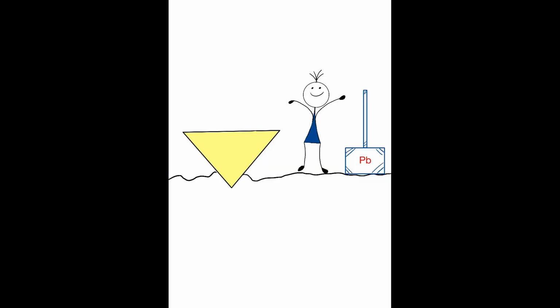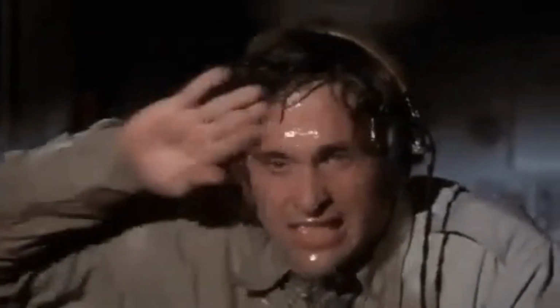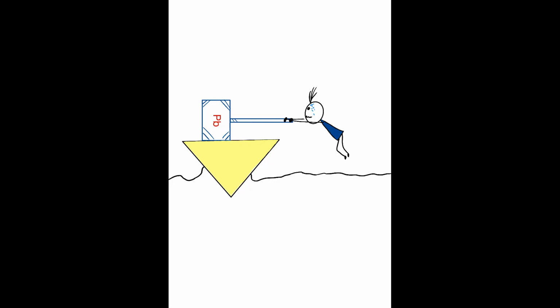Looks like Bob is trying a load step experiment next, another method to achieve high strain rates. With the tip already in contact, just a little bump needs to be brought up. Just let me get this hammer up here. It's so heavy. Just don't tip over, Bob. Smash! Oh my God, I'm so sorry.